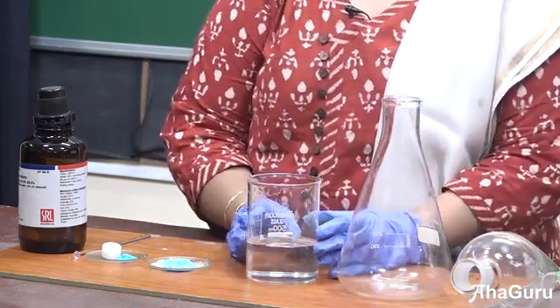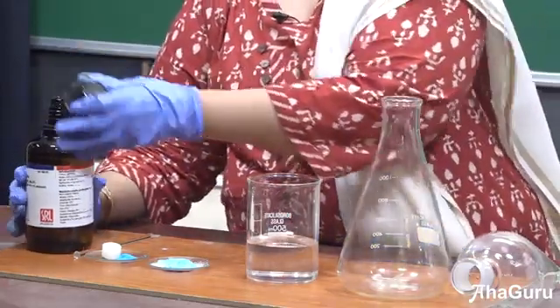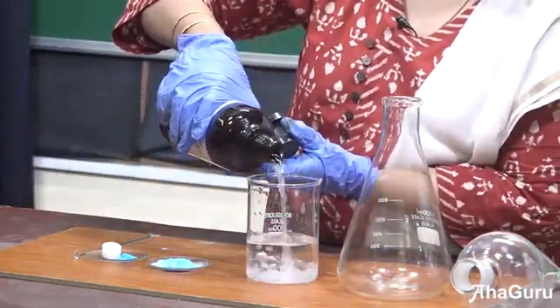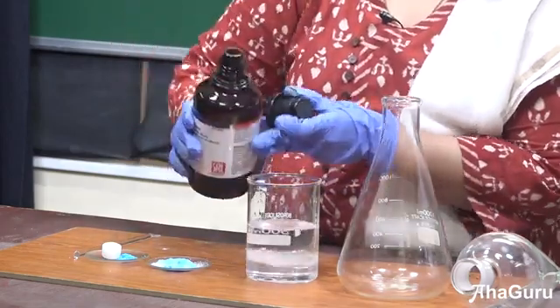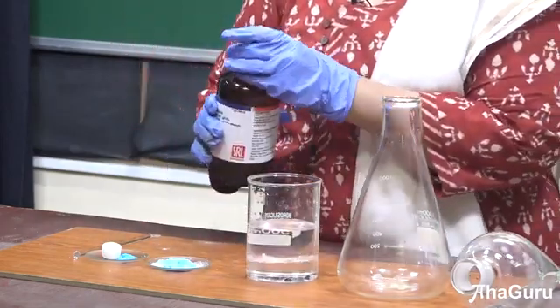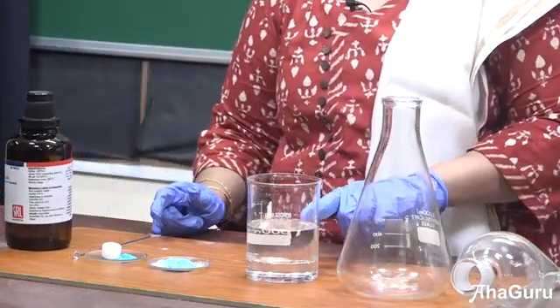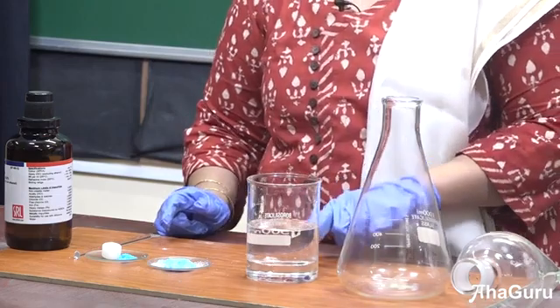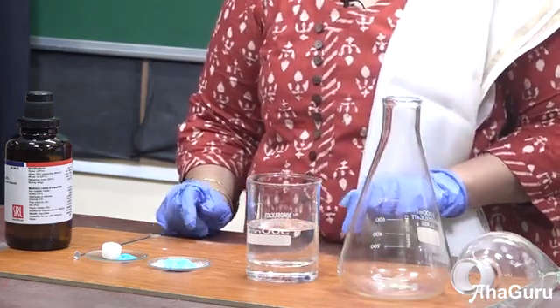Now I am going to take two solvents. Here I have taken water, and I am also going to add chloroform to this. You can see that two layers will be formed — one is the chloroform layer and the other is the water layer. This separation is because one is polar and the other is non-polar.